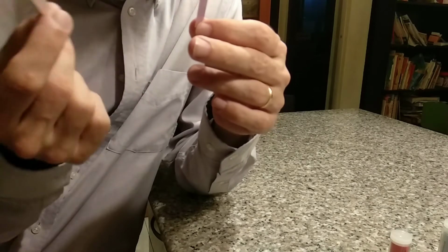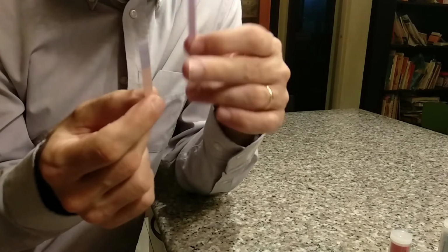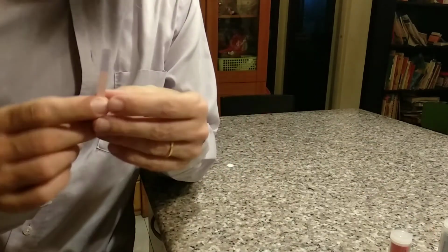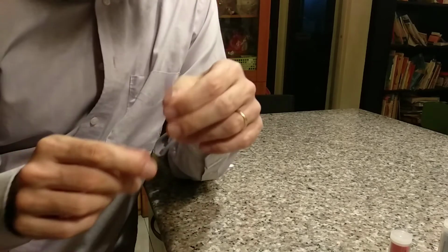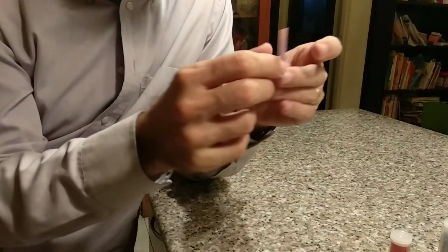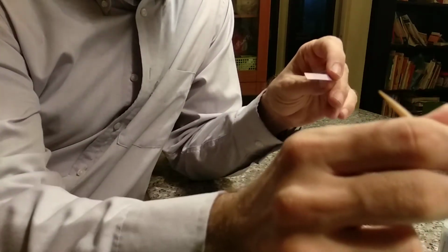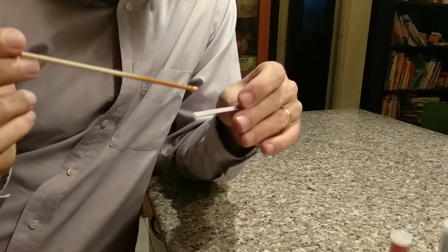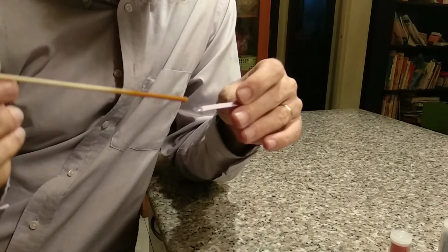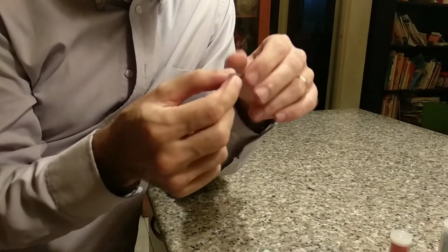If you only had red litmus paper and you didn't have any blue litmus paper, you could put a little bit of base onto it, and then you could put an acid on that and change it back, or vice versa. If you have the blue litmus paper, you could put a little bit of acid onto it and turn it to pink or turn it to red, and then we put the base onto it and it turns it to blue, right?